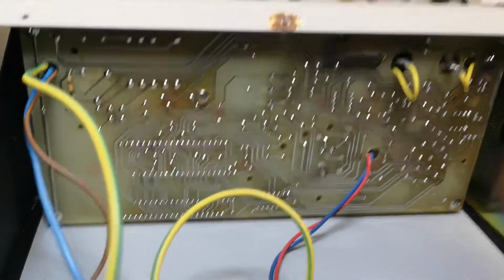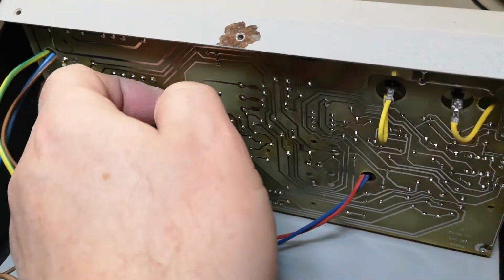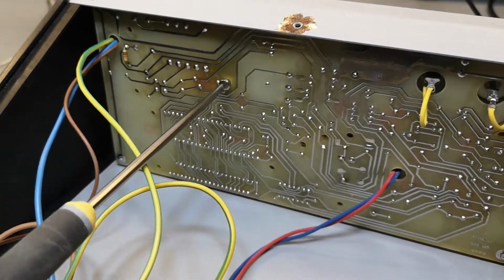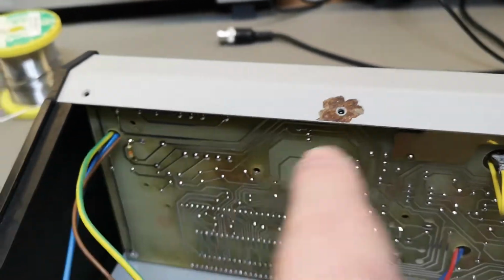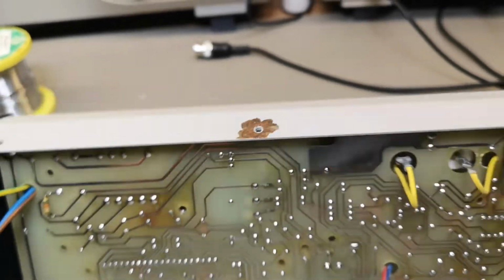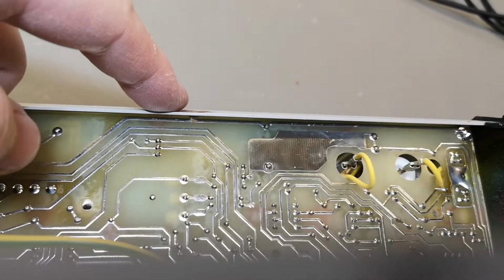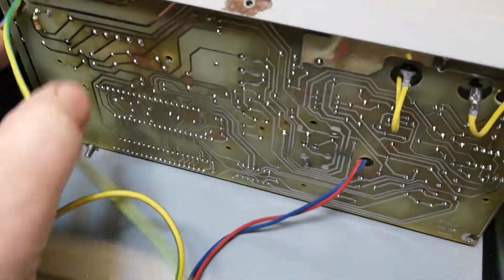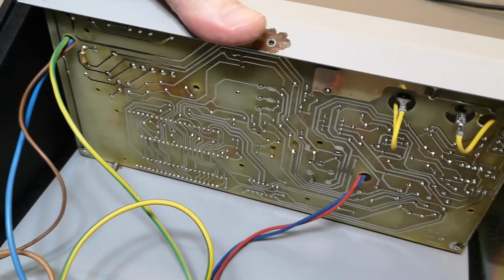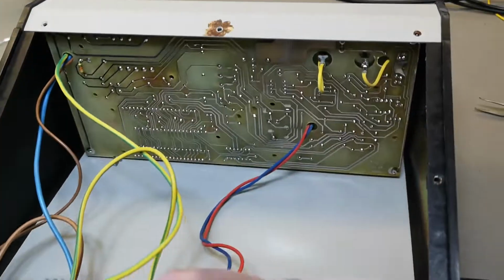I did remove the 4 screws, but nothing seems to be coming anywhere. I think we are stuck because of this screw. Why don't you just go out? Also, there's another thing I like to show here. This screw is for the bottom plate. Why is this so rusty? If you look carefully, maybe I can show it from this angle. I need to have the camera all the way on the edge. Can you see? The screw actually hits this track, which is grounding. Yeah, okay. So why don't you come out? Just doesn't happen. I need to be either more brutal or figure out how this is done. Hang on a second, we're gonna see.